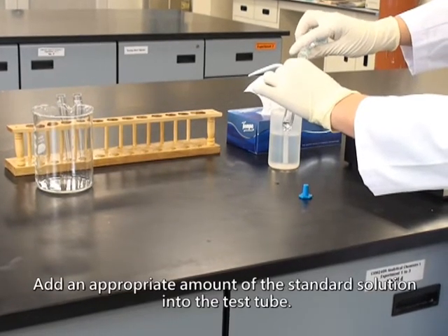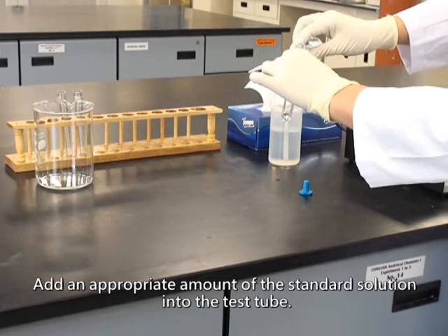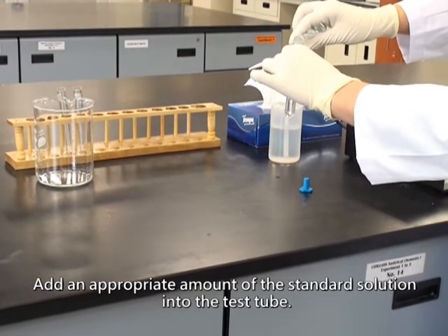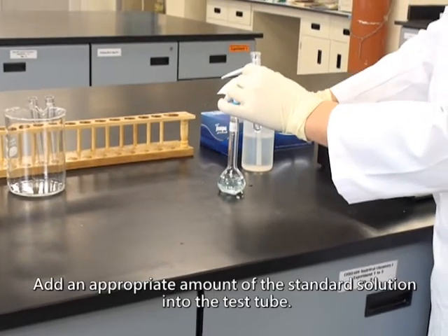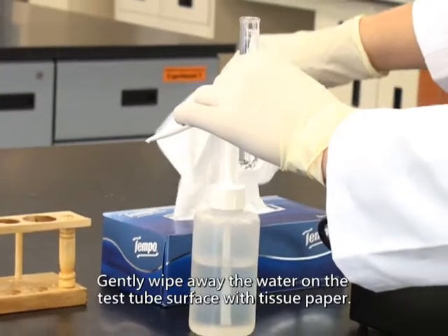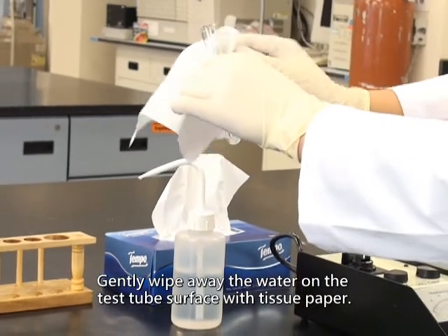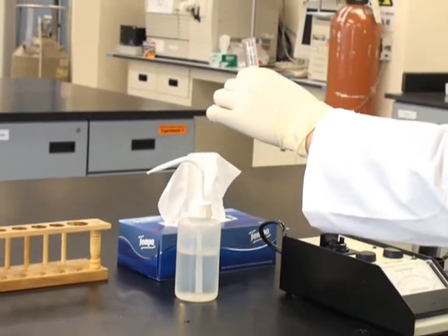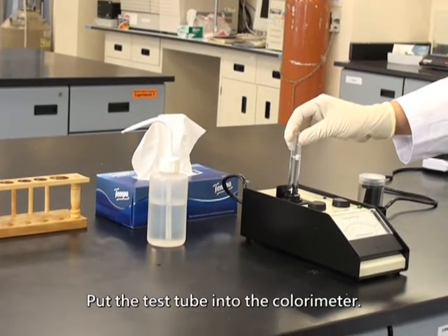Add an appropriate amount of the standard solution into the test tube. Gently wipe away the water on the test tube surface with tissue paper. Put the test tube into the colorimeter.